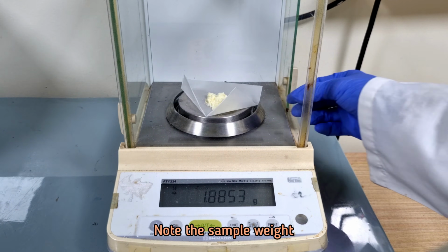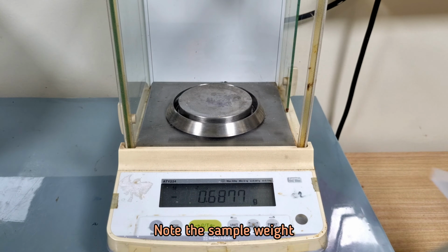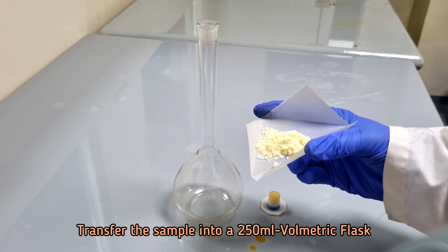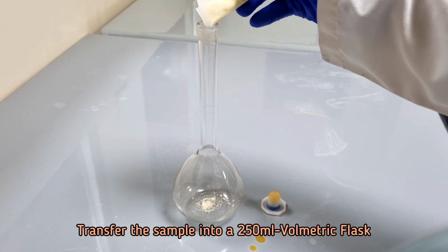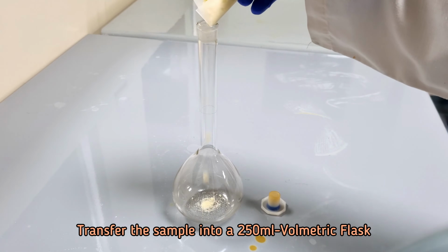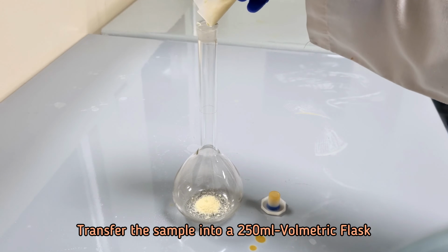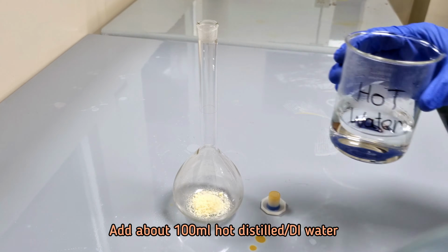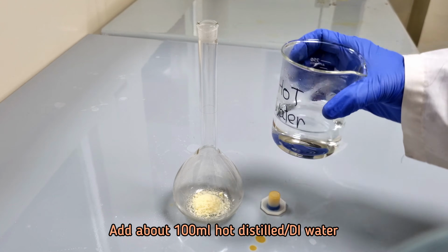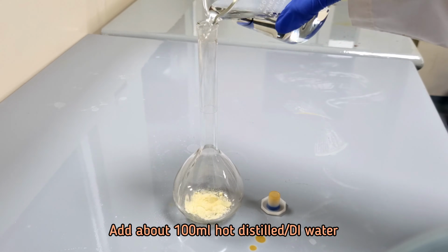Note the sample weight. Transfer the sample into a 250 ml volumetric flask. Add about 100 ml hot distilled water and swirl to mix the content.